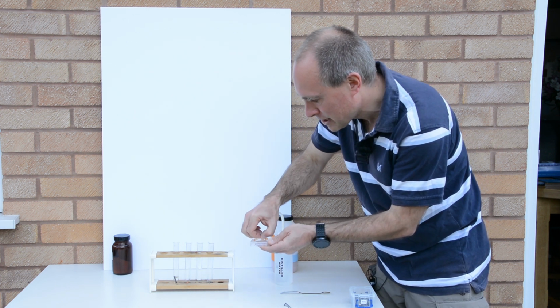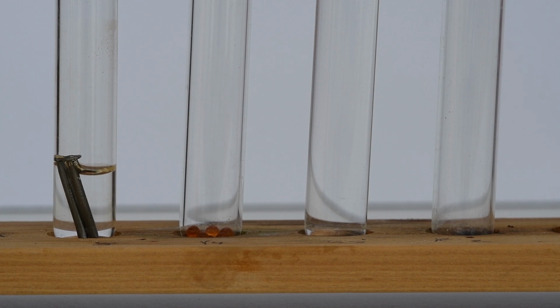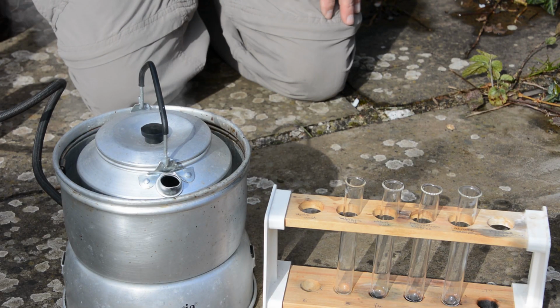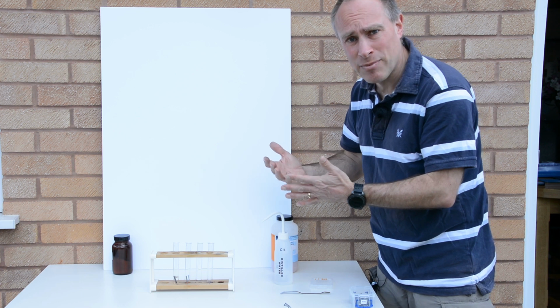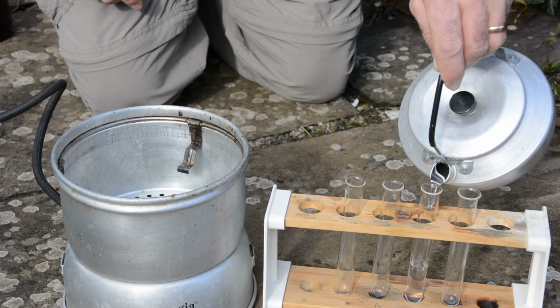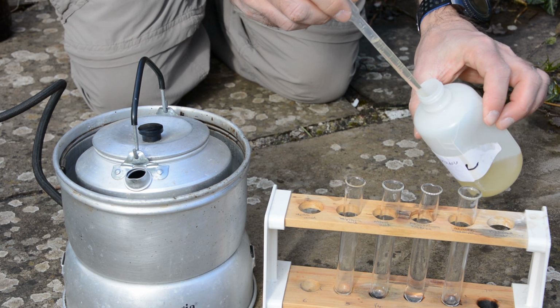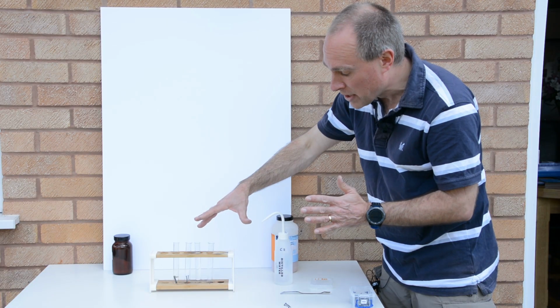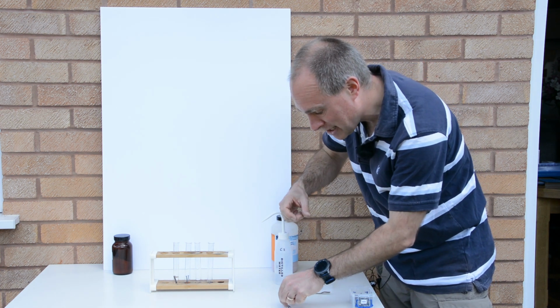So just pop these crystals into here, and a couple of nails into that one. In the third tube I took some water and I boiled it for a couple of minutes just to get rid of any air that might be dissolved in that water. And once I'd boiled it, I put a little layer of oil on the top of it to act as a barrier to stop any more air getting into that water. And so hopefully I've got some water there but without any air, so no oxygen in that test tube.